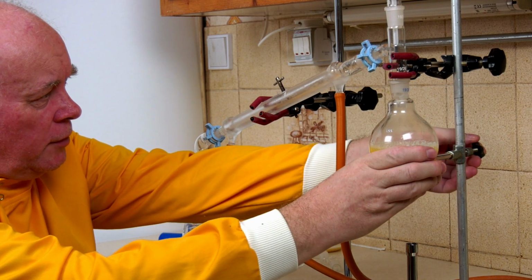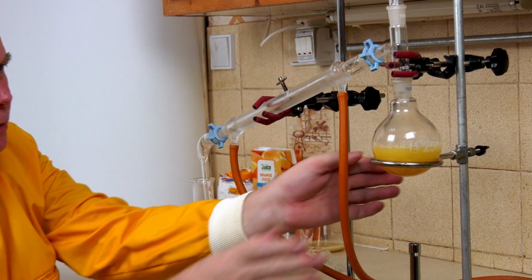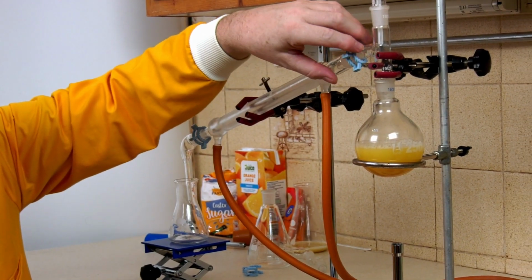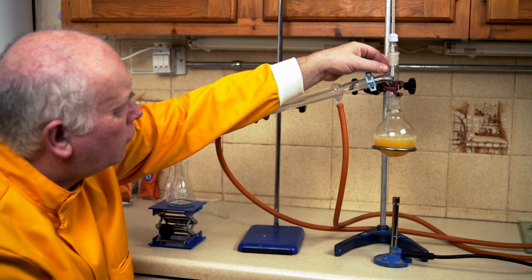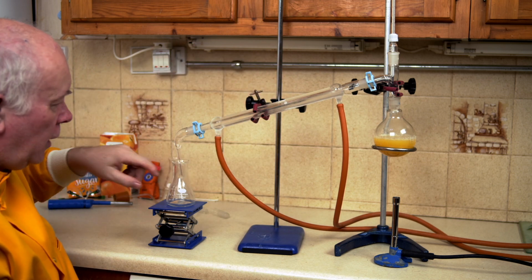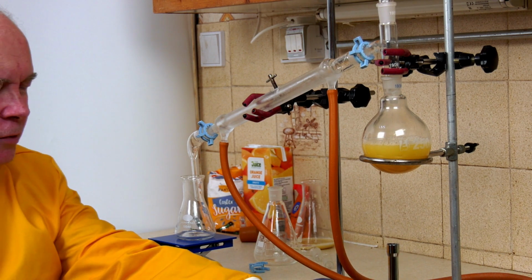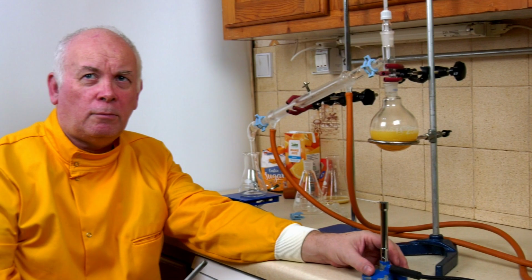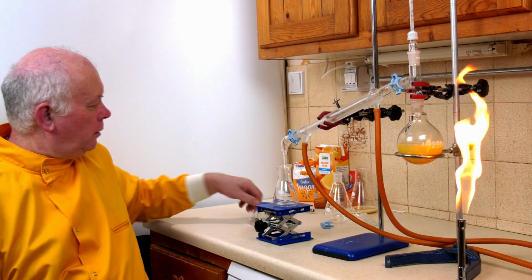And the ring is then going to hold and support this. So we've got a ring stand here which will support this, and then it's connected to this distillation arm with its thermometer, cooling in the Liebig condenser and collection. We're ready to go. So let's turn the gas on. We've set the Bunsen safely and we'll get going. Now we've got the Bunsen lit, we're ready to start.